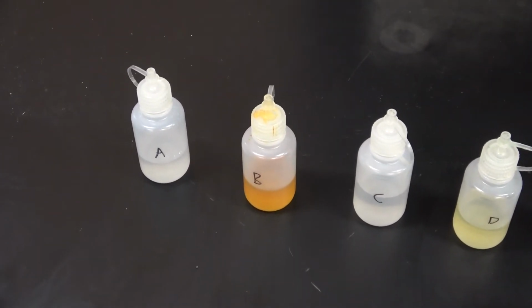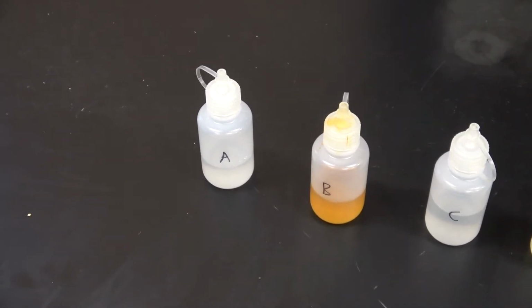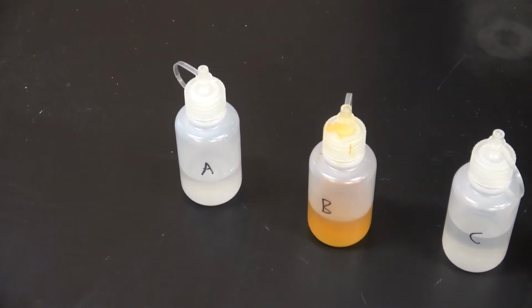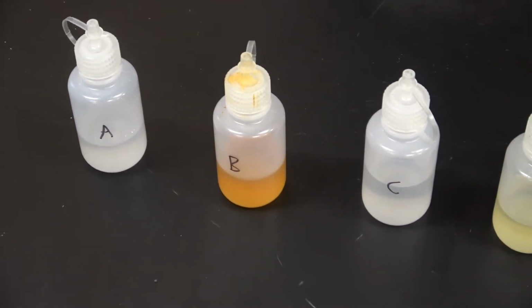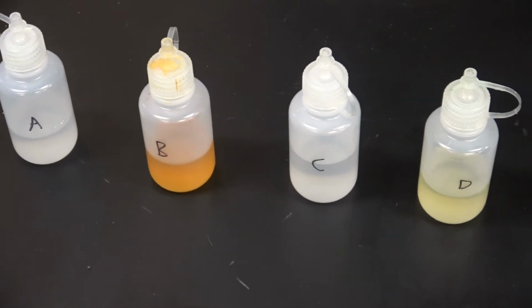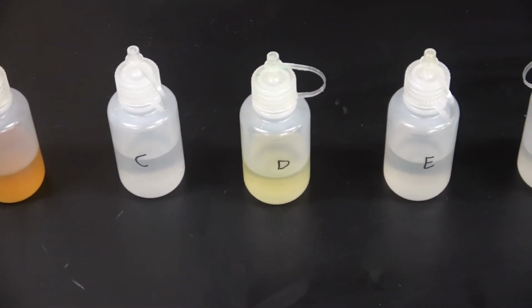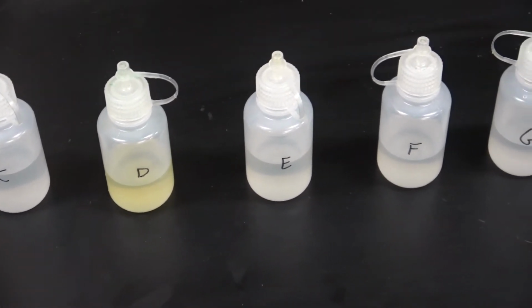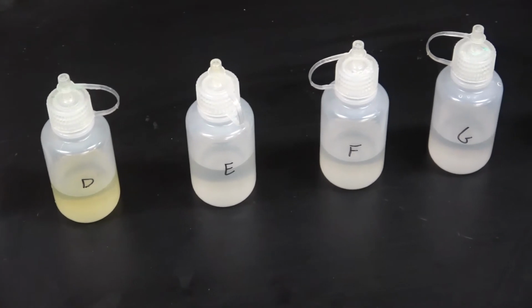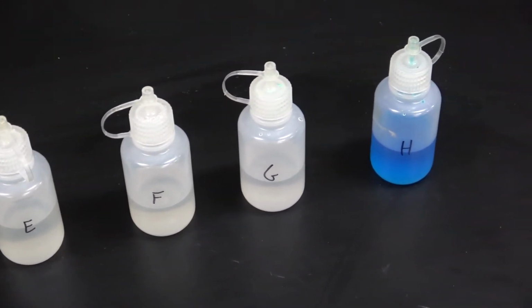part 1 of this. I'll give you a quick chance to look at each of these chemicals as a pre-observation, and then we'll repeat the experiment, combining them in twos, just as we did in part 1, so you can look at the chemical reactions. And I'll remind you, sometimes it's just as important to see what doesn't happen as it is to observe what happens.